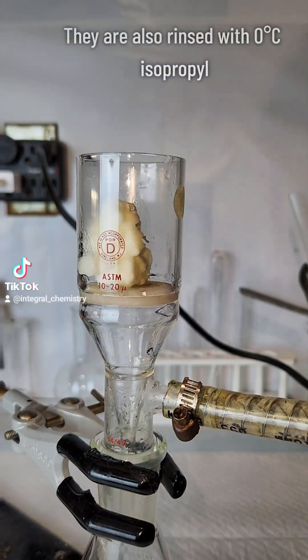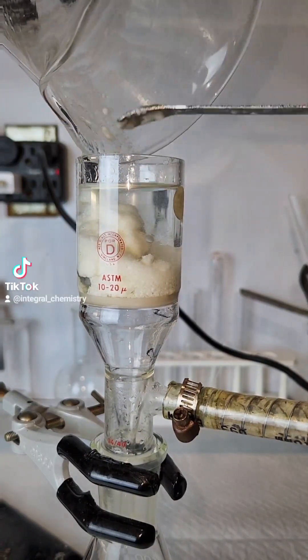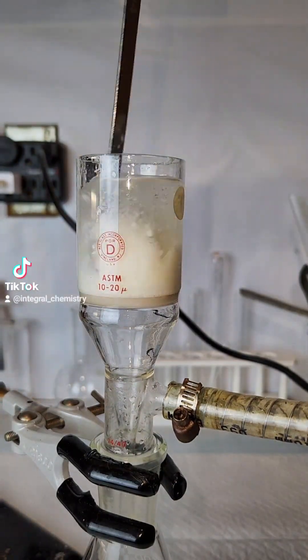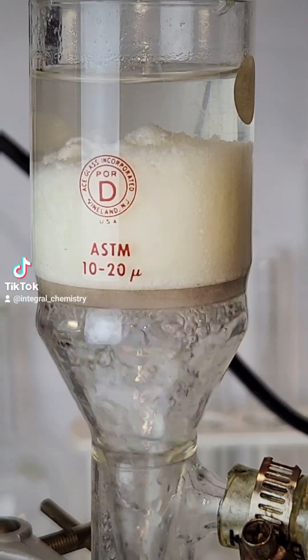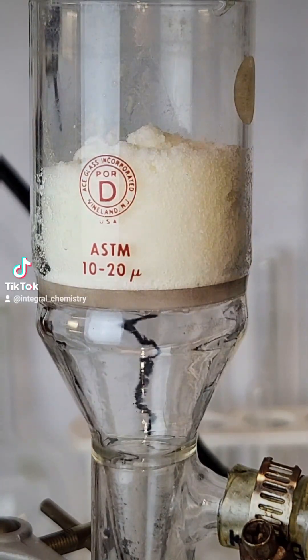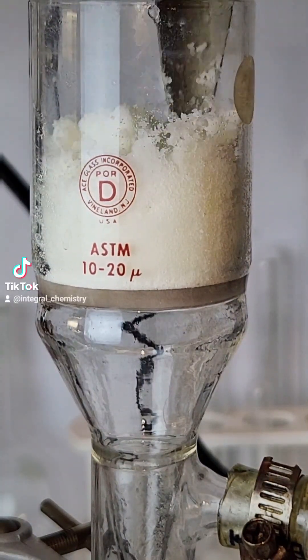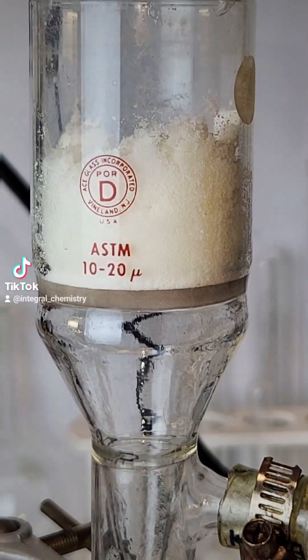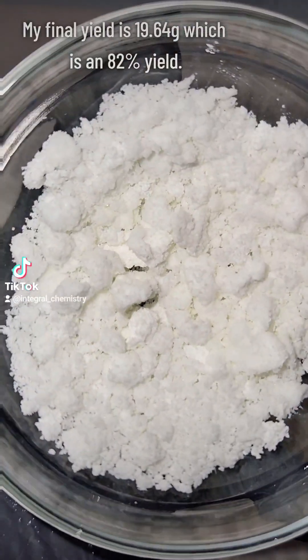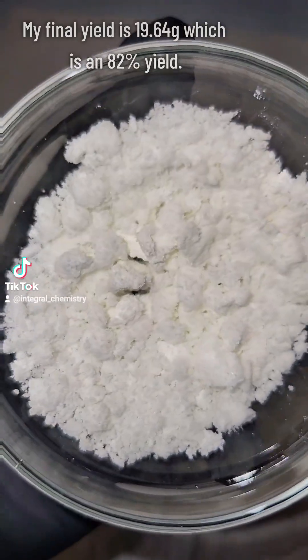The filtrate is boiled down to crystallize my mostly pure lithium hydroxide. The lithium hydroxide crystals are then transferred to a vacuum filter and washed thoroughly with isopropyl alcohol. I pull a vacuum on these for about 5 minutes to get them as dry as possible before desiccating for 24 hours. At that point, I'm left with my pure, dry lithium hydroxide crystals, and I got a yield of 19.64 grams, which represents an 82% yield.